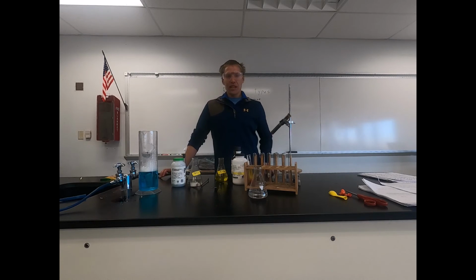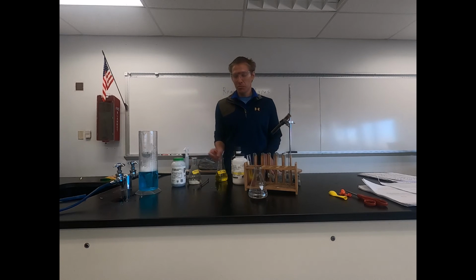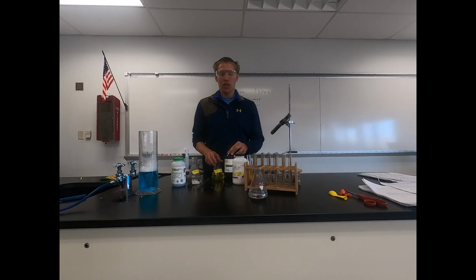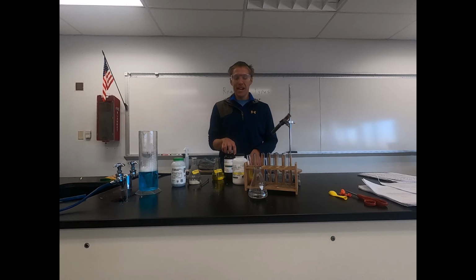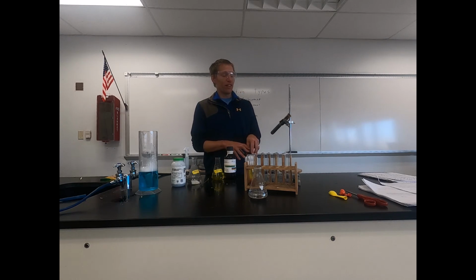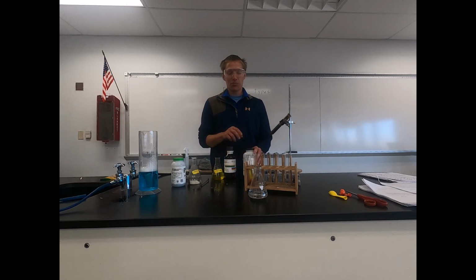So again, today we just looked at examples of each one of our reaction types. We had zinc and hydrochloric acid for our single replacement. We had potassium chromate and silver nitrate for our double replacement. In synthesis, we're using aluminum and iodine. Then we did our flaming gummy bear with the potassium chlorate, and we added a gummy bear for a combustion reaction following that. And finally, we did combustion with our methane gas, creating bubbles and catching those bubbles on fire, reacting with oxygen. So those are our 5 major types of reactions we're looking at in here.